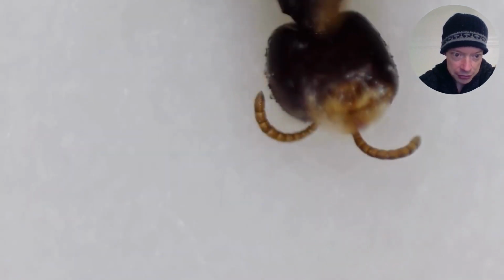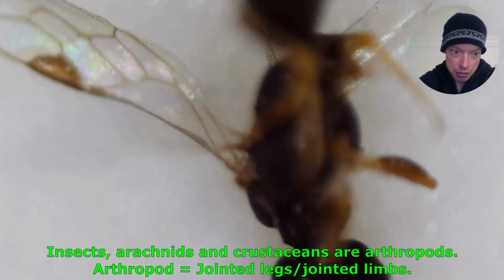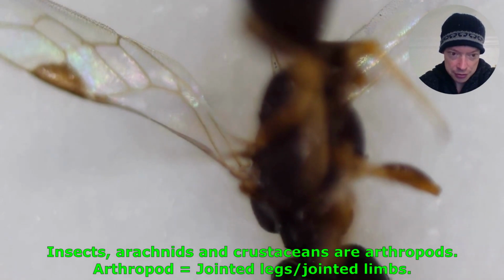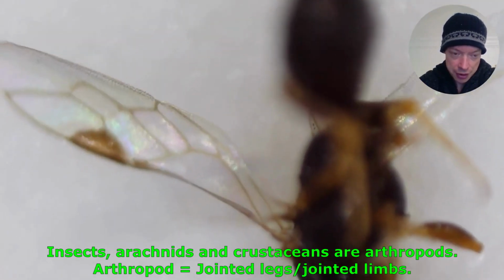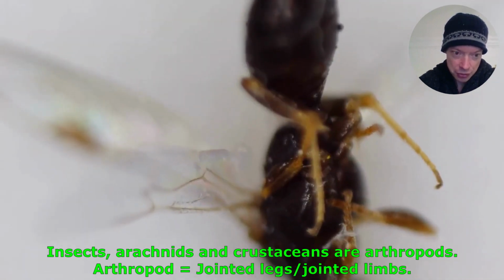And now we can see the head of the insect, and you can see the antennae. The interesting thing about the antennae is that they're segmented. The reason why insects, spiders and crustaceans are called arthropods is because the legs are divided into segments. The name arthropod literally means jointed limbs or jointed legs.